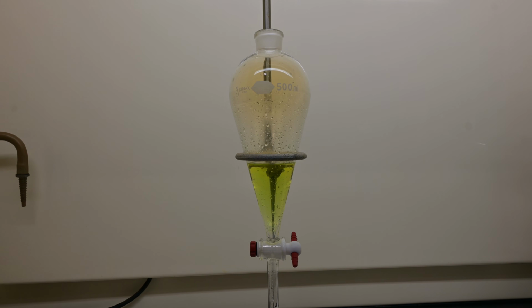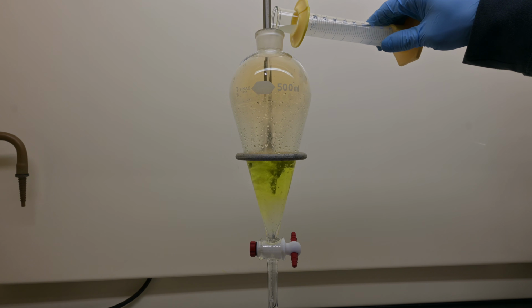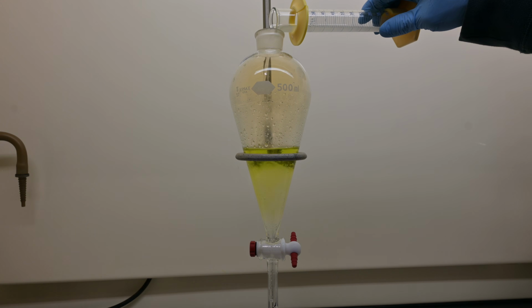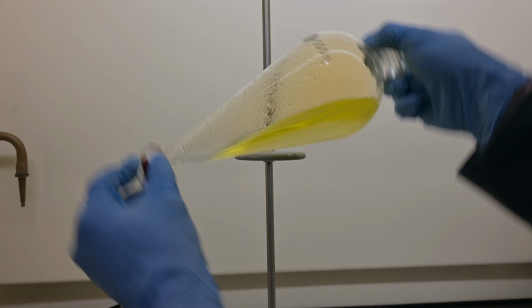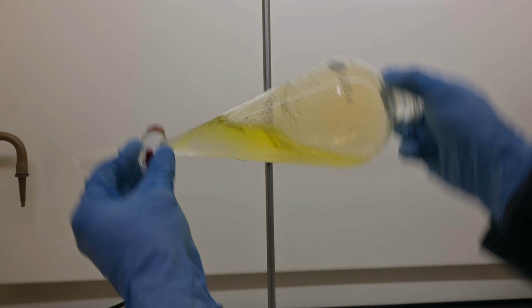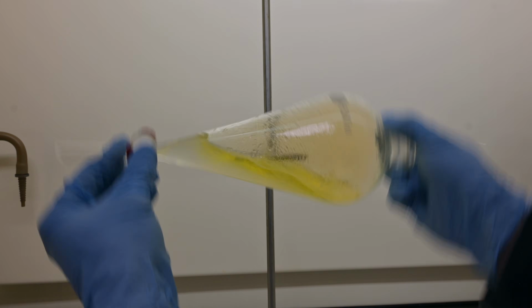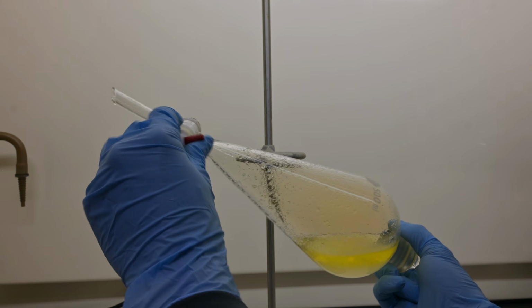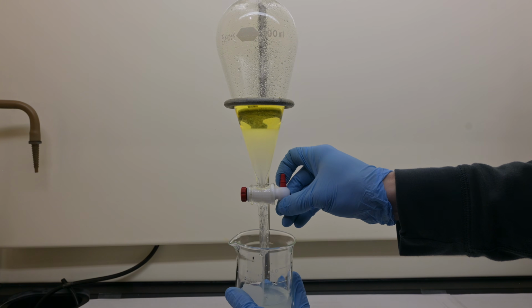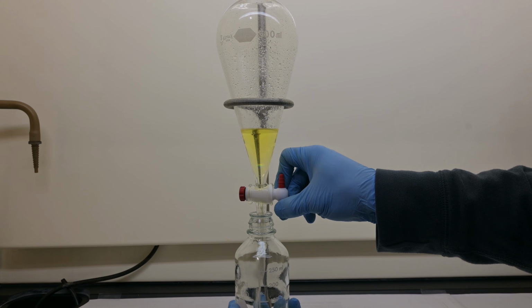Now let's clear out any lingering acid or base impurities. We do this by washing the organic layer twice with about 50 milliliters of a special washing solution. This solution is prepared by dissolving 2 grams of sodium bicarbonate and 25 grams of sodium chloride in 100 milliliters of water. The sodium bicarbonate neutralizes any leftover acid, while the sodium chloride boosts the ionic strength, helping your organic products separate nicely from water. Once the washes are done, transfer your butyl nitrite to a storage bottle.